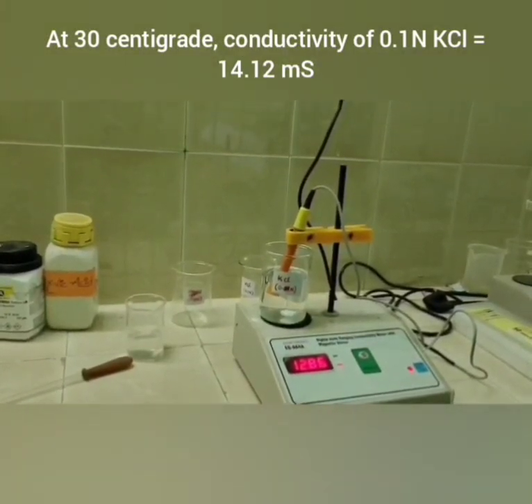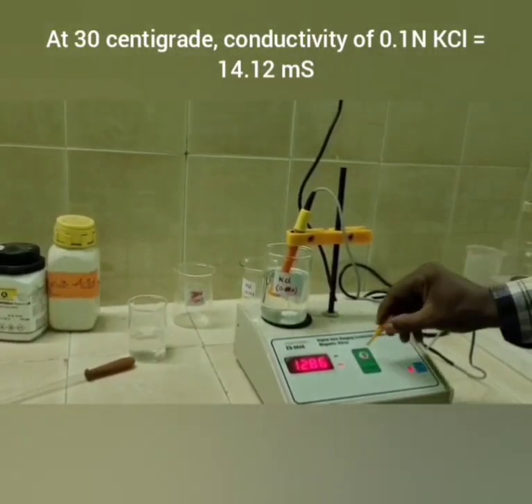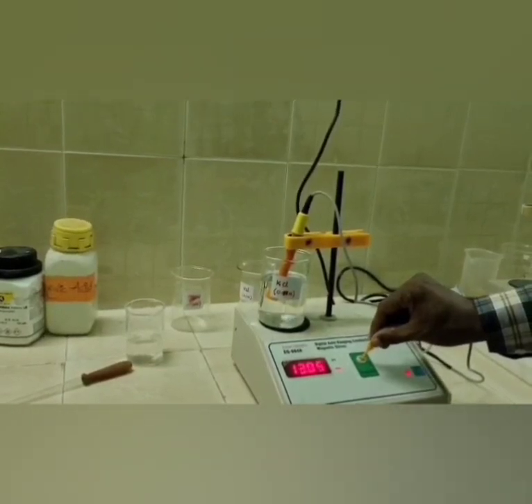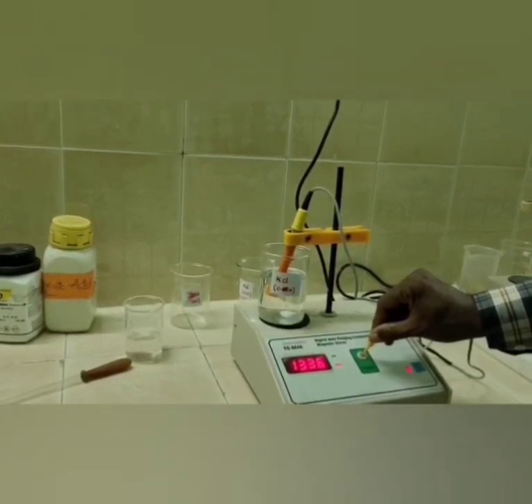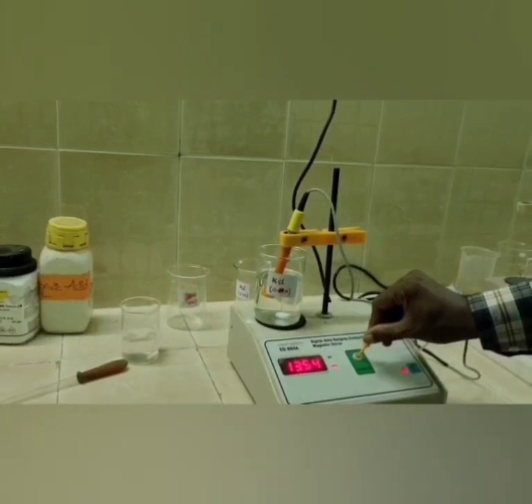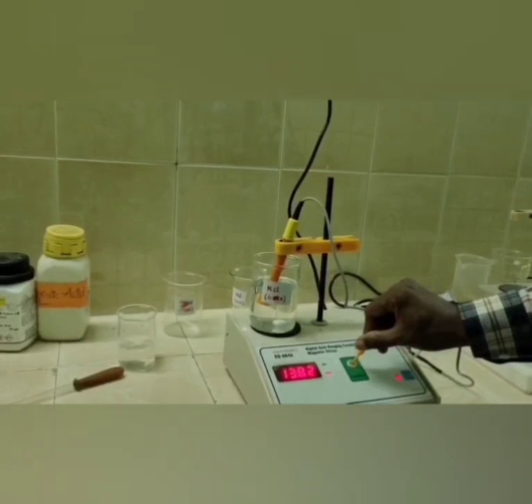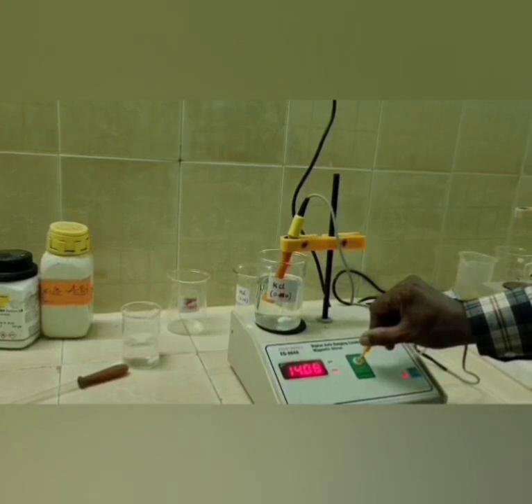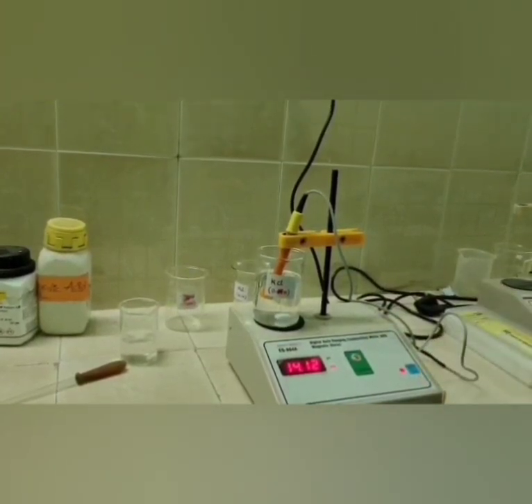So, turn the calibration knob till the reading shows 14.12 millisiemen. Here the value is 14.12 millisiemen. By this, the calibration is completed.